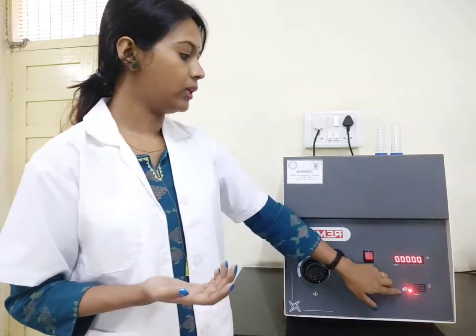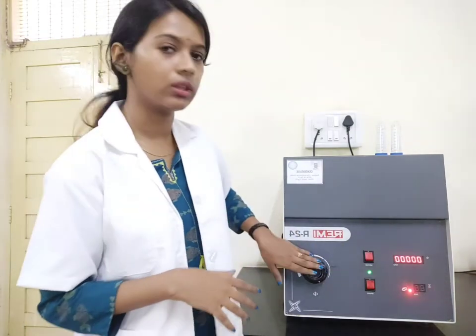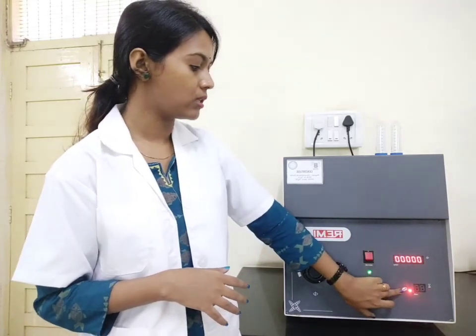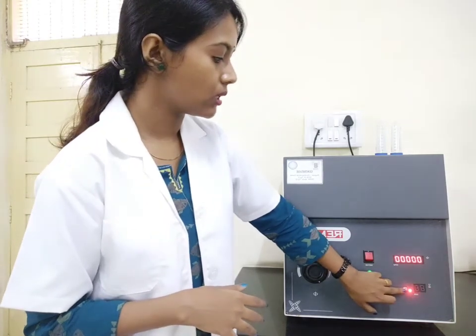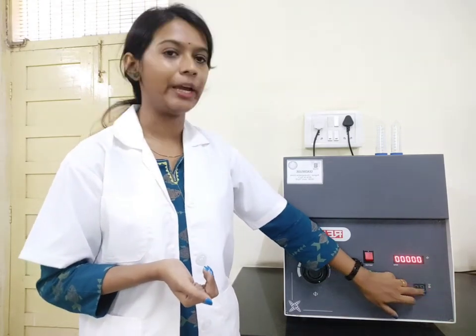The next thing is about time — the second panel that you can see is for time, indicating how much time you want the centrifugation process to take place. Most of the time in procedures you will find that you have to centrifuge at 8000 rpm for 10 minutes. So with this regulator you set the rpm, and you can also see there is a set button for time. Once you press this set button the time will keep increasing, and that is how you can set the time — for example, to 10 minutes.